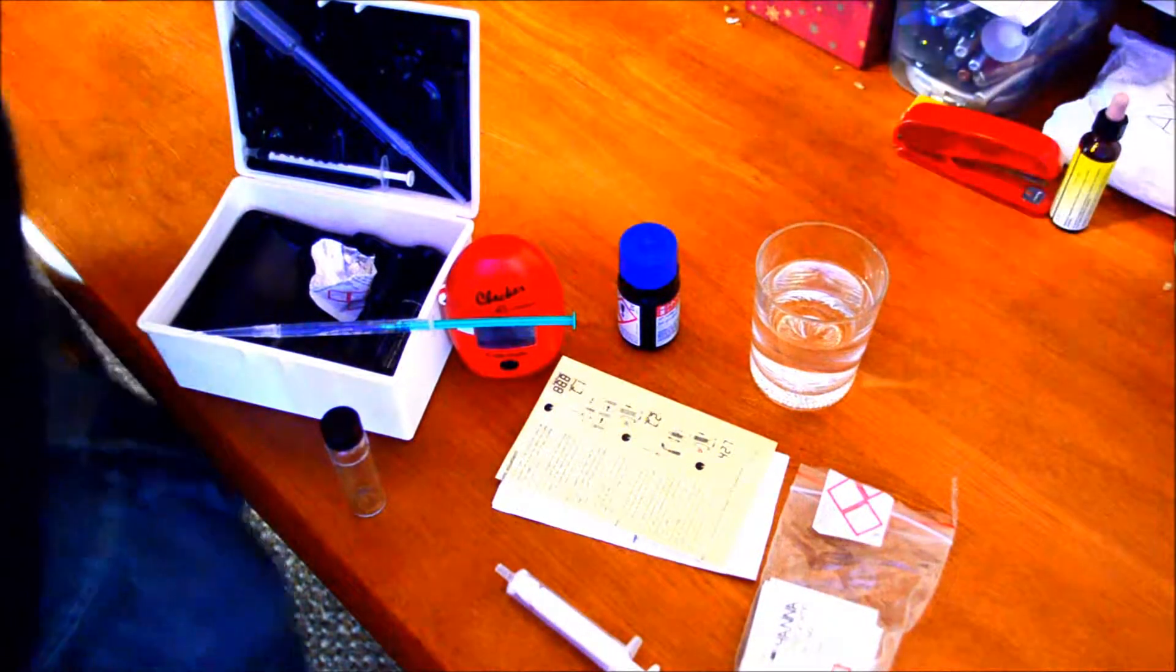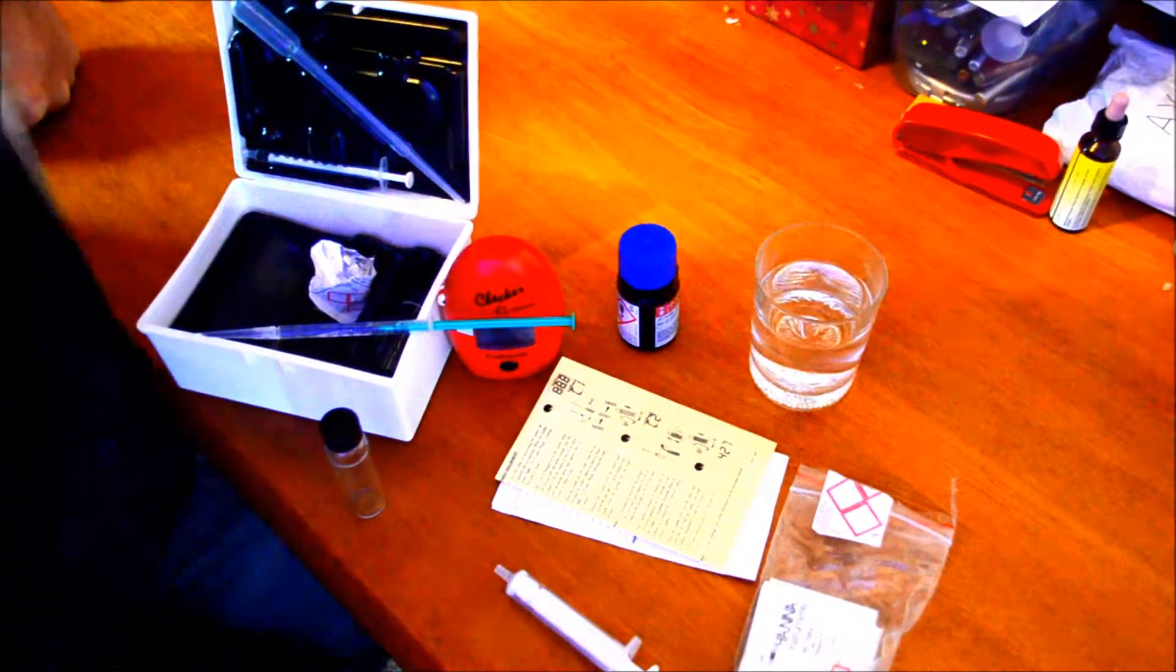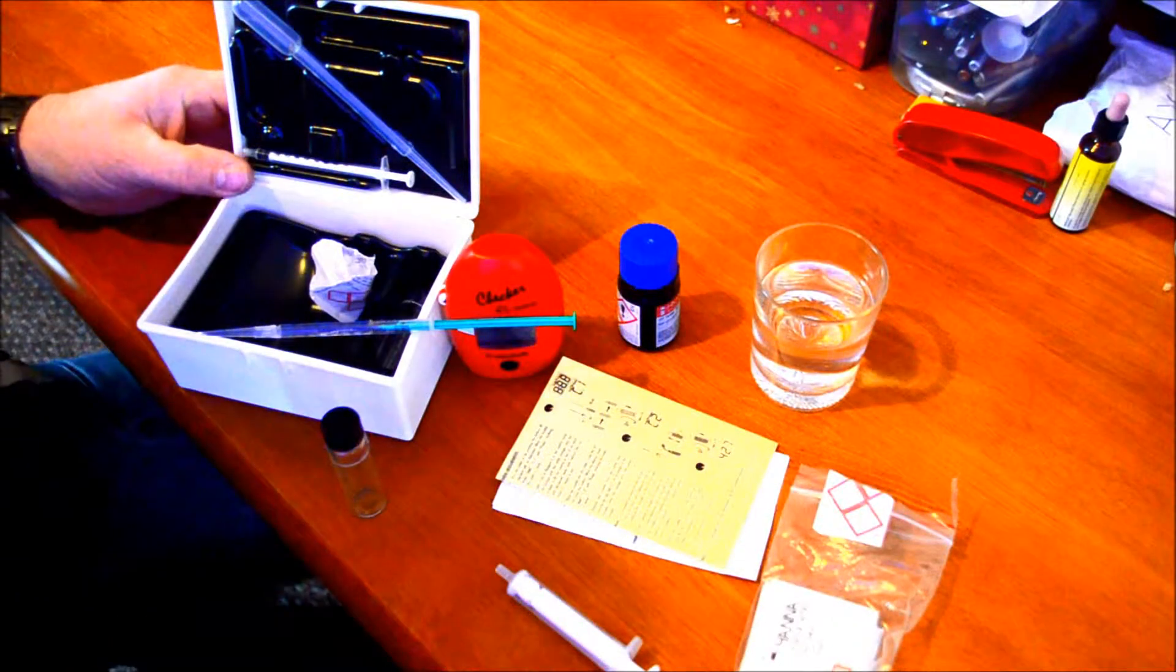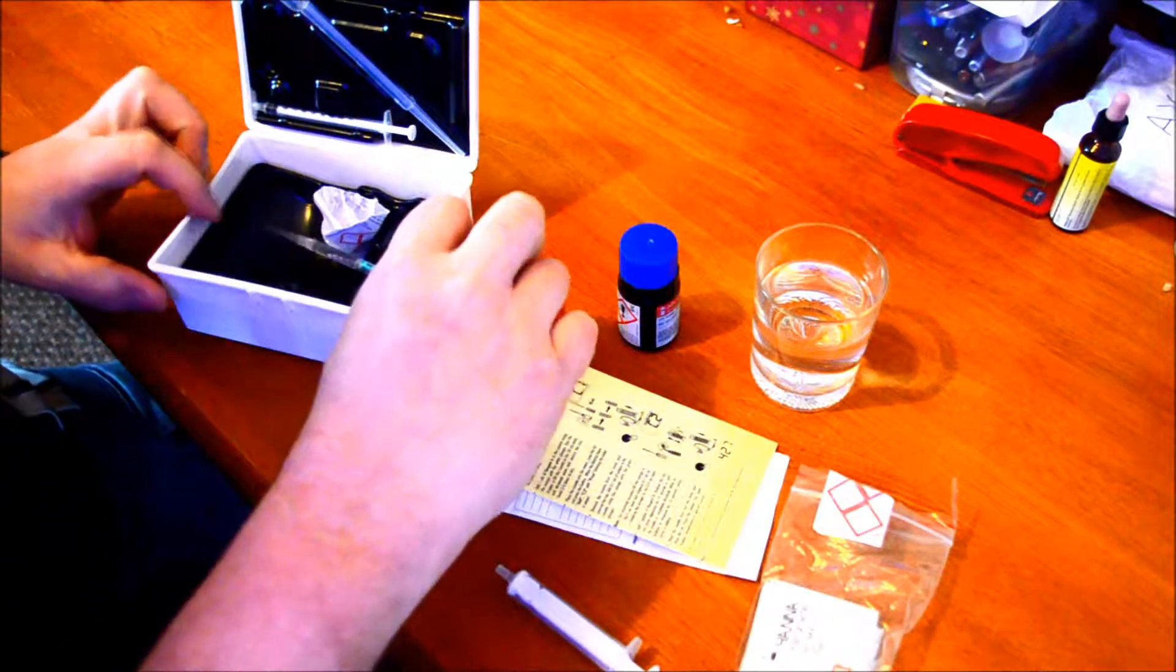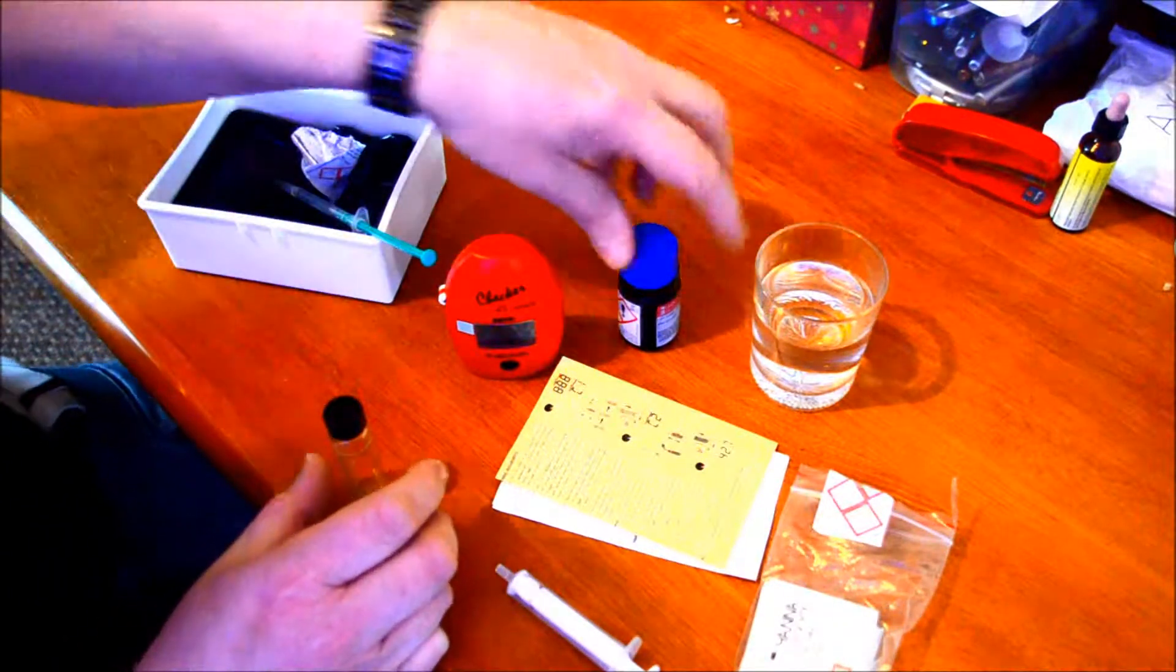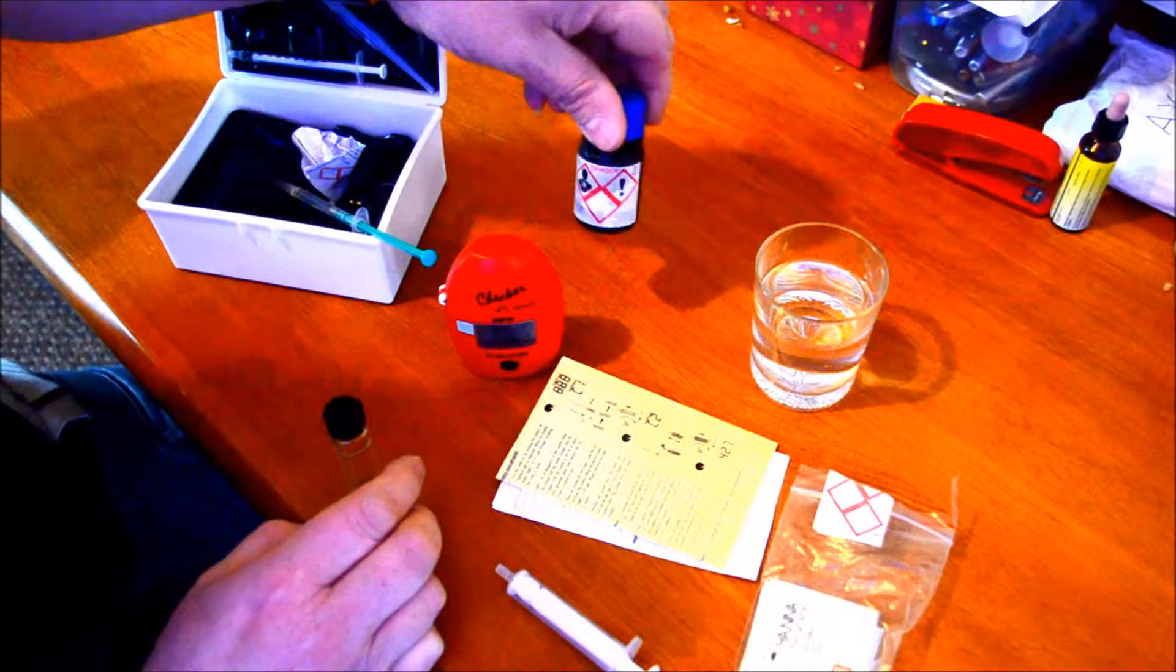So here we go. I've got all the stuff ready. What you do is add one milliliter of this dosing agent first to the vial, which I've already pre-filled because I thought I might be having to hold the camera, but I'm not.